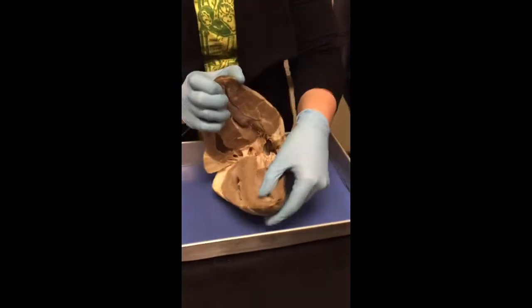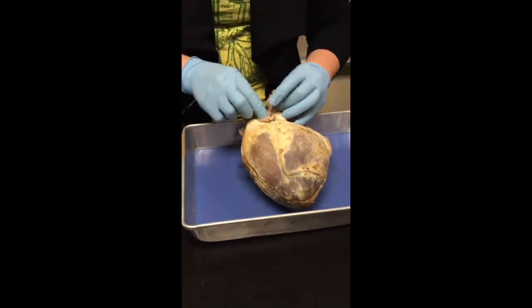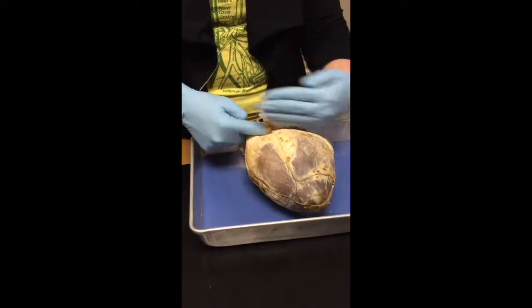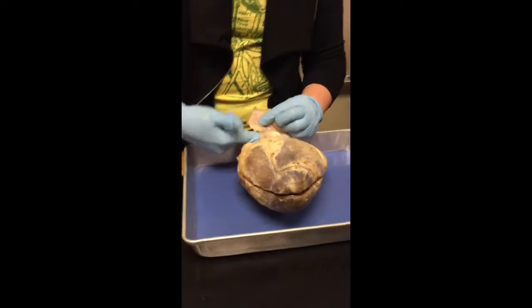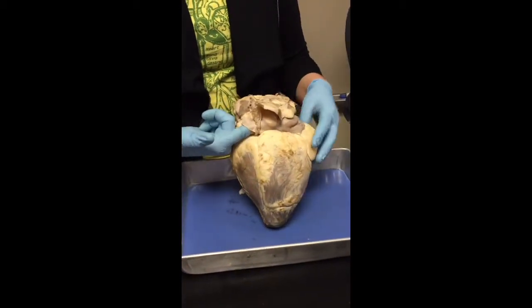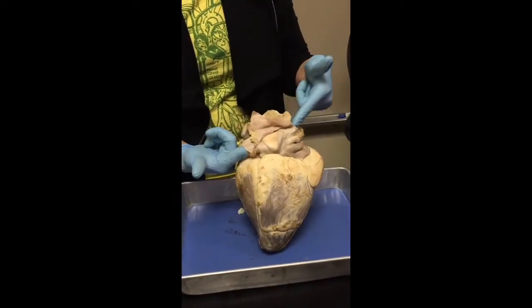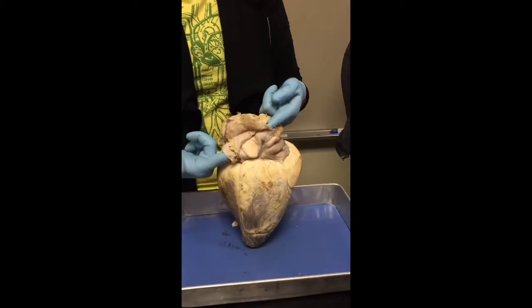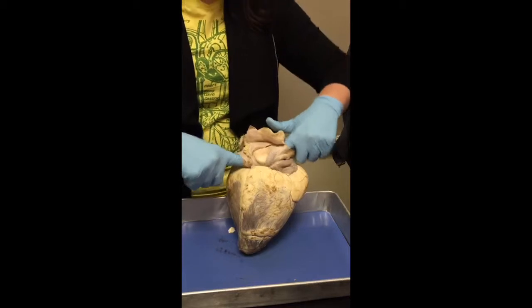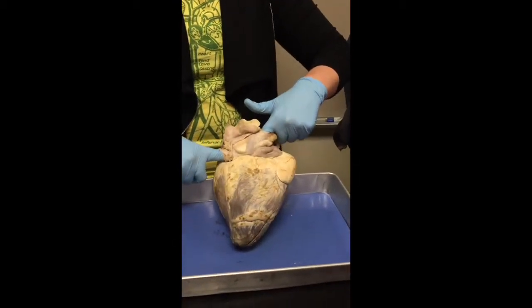So here, left side, so think still left side, this vessel right here, right next to the base of the heart where all the vessels come off of. Okay, this is the inferior vena cava where all the deoxygenated blood from below the heart's going to go. Up here, more superiorly, this is the superior vena cava where all the deoxygenated blood from above the heart will go. And when you put your gloves on and you look at the heart, you'll be able to tell your fingers are touching. So it's all going to the same place. My fingers are touching right now.